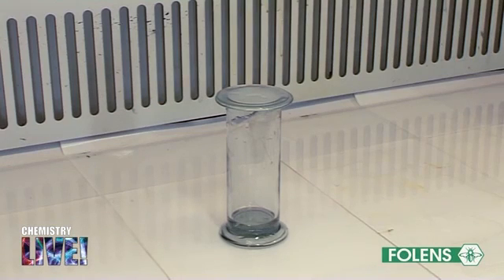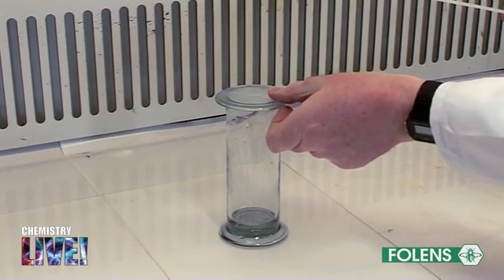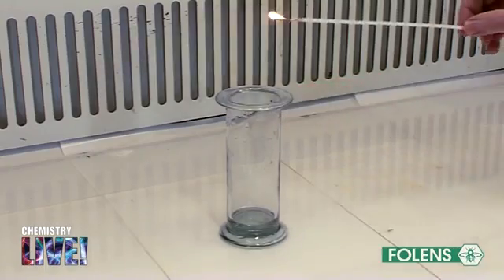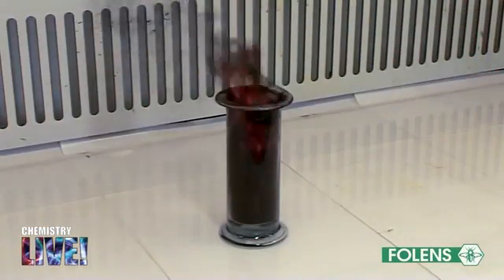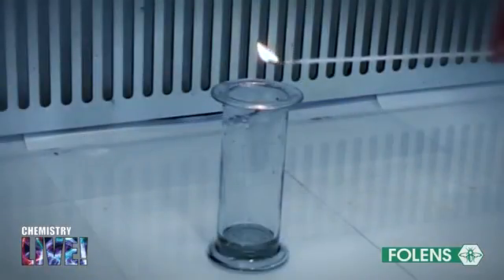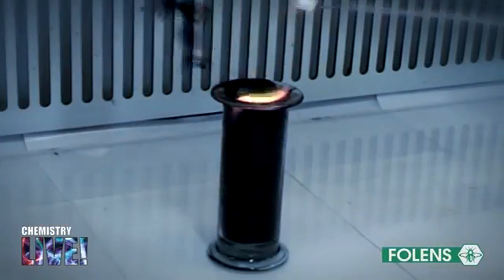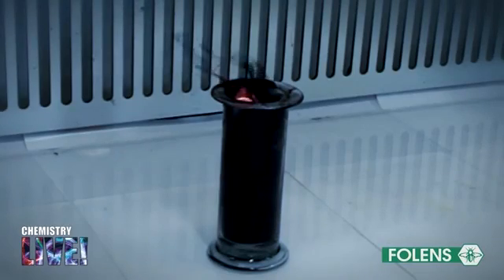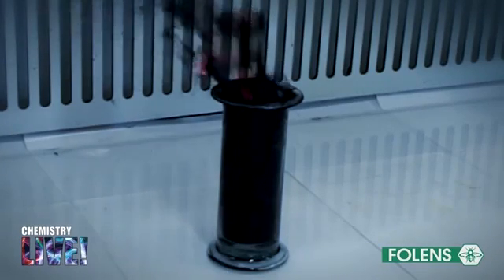Combustion. If your teacher allows it, bring the gas jar of ethyne to the fume cupboard. Remove the gas jar cover and apply a lighted taper to the mouth of the gas jar. Note that it burns with a luminous smoky flame and a great deal of soot is formed. The soot is formed as a result of unburned carbon.